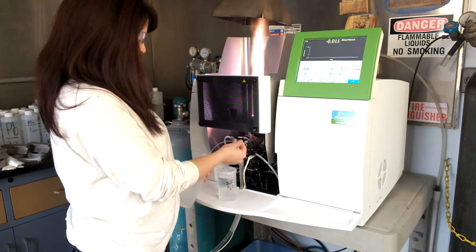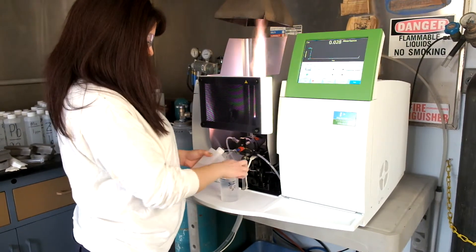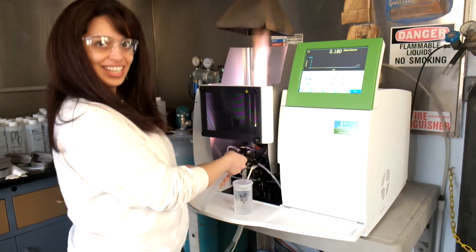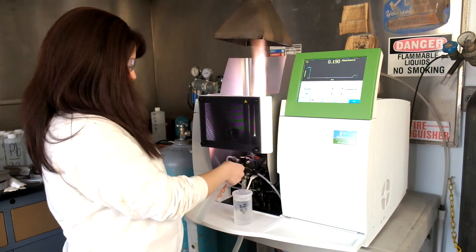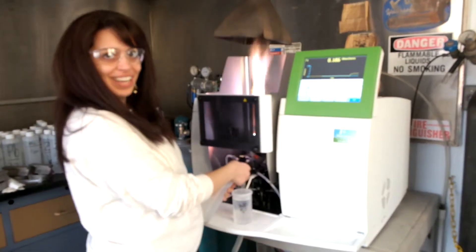Alright, so tell me about this device. What's it called? It's an AA. An AA. What's that stand for? Atomic absorption spectroscopy.